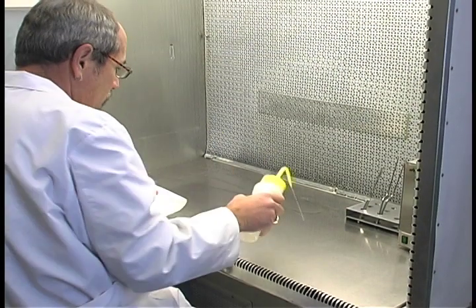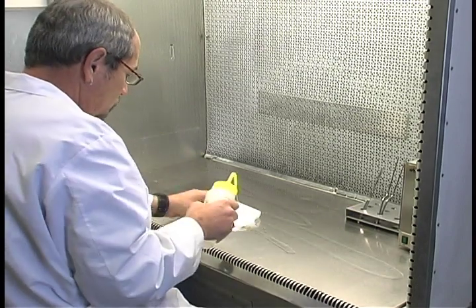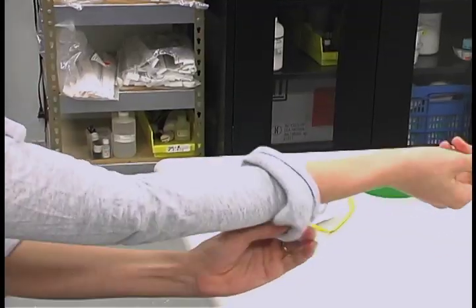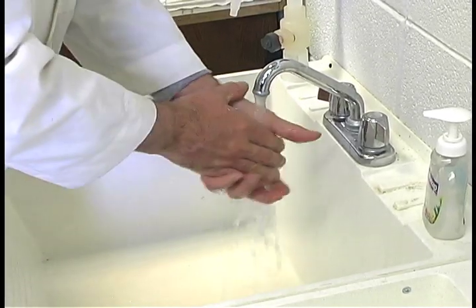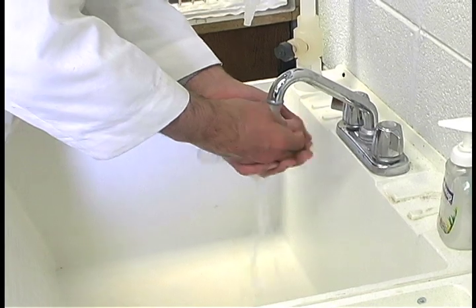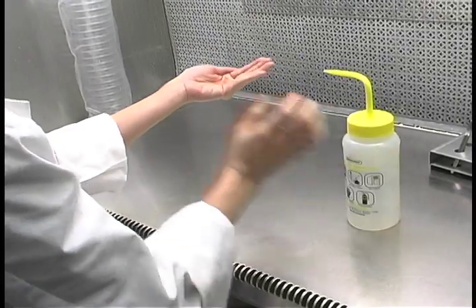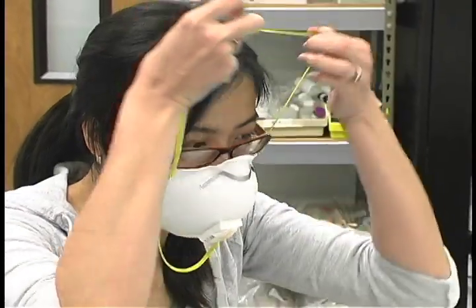You should always be aware of potential sources of contamination such as dust, hair, hands, and clothes. All jewelry should be removed, hands washed, sleeves rolled up, and long hair tied back. Hands should be washed, not scrubbed — scrubbing dries hands and creates flakes of skin that have bacteria — and sprayed with 70% ethyl or isopropyl alcohol or coated with isopropyl alcohol gel. Gloves and masks provide extra protection.